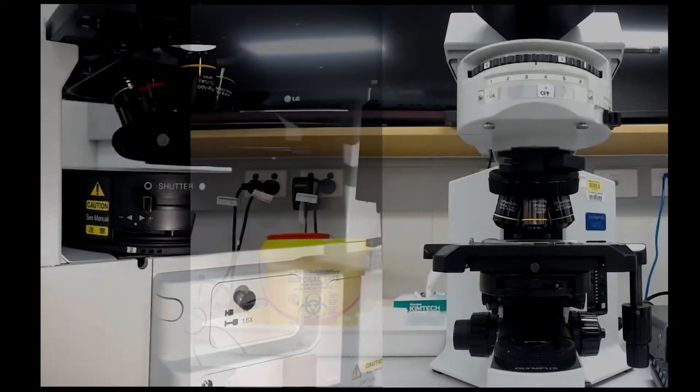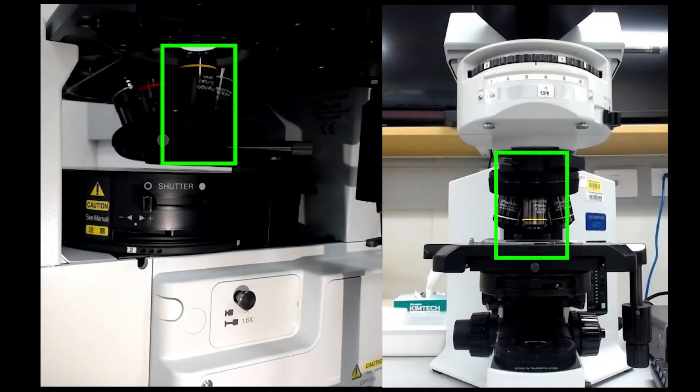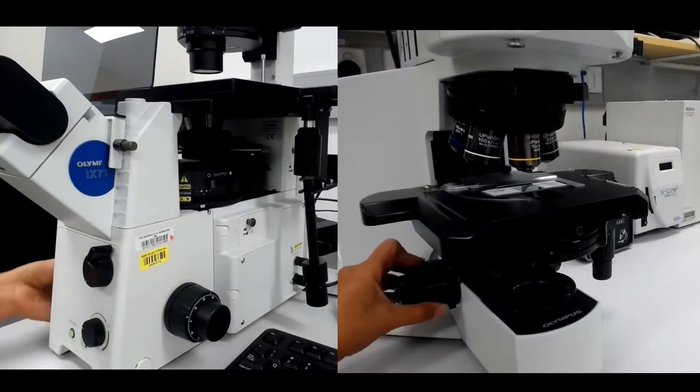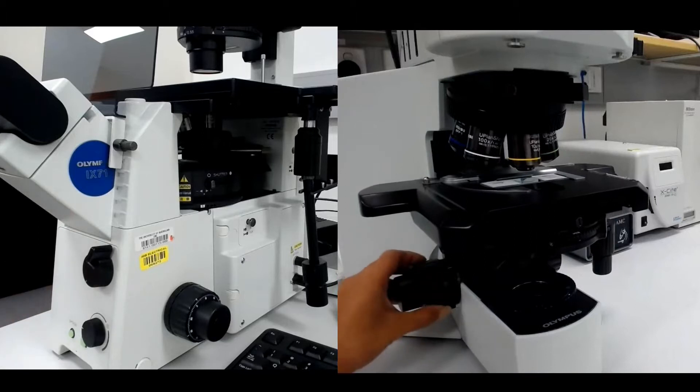Starting with a low magnification dry objective, such as a 4x or 10x, bring the specimen into focus by moving the objective towards your sample.